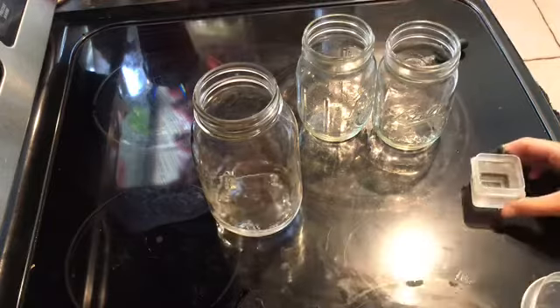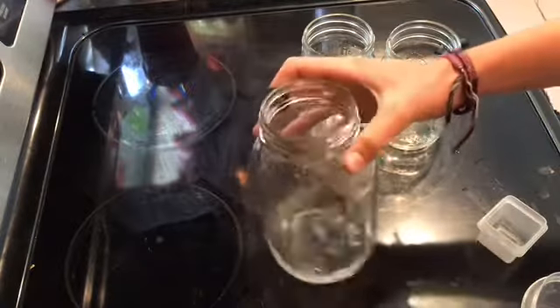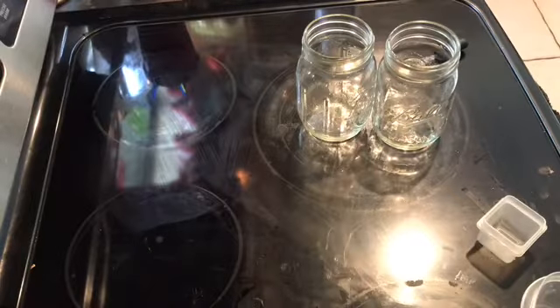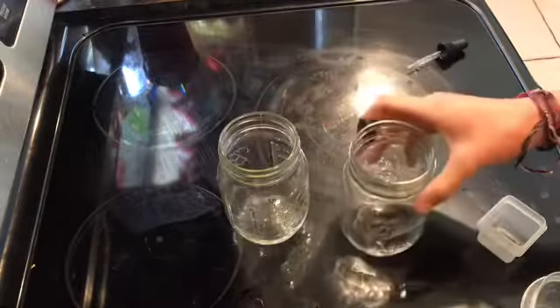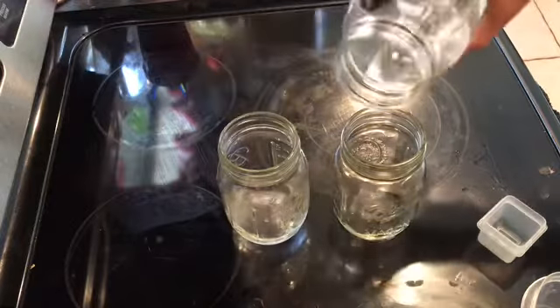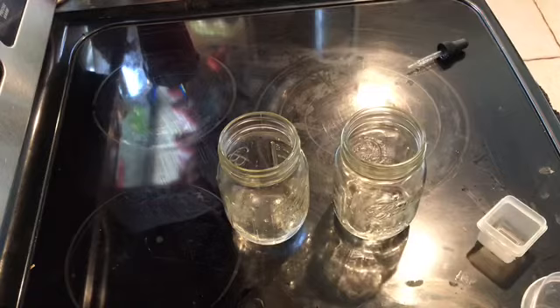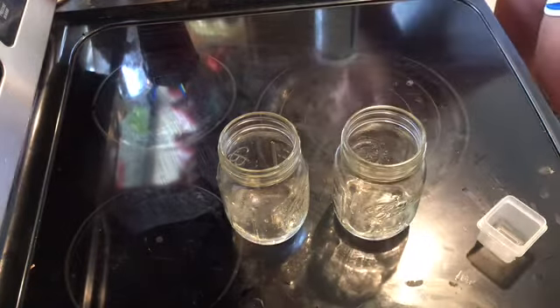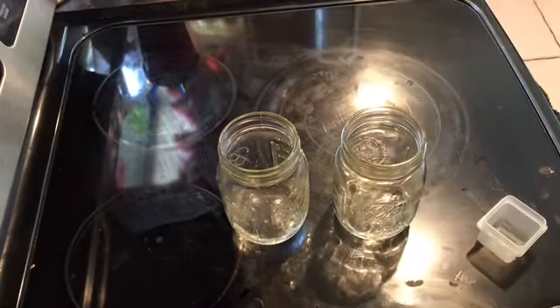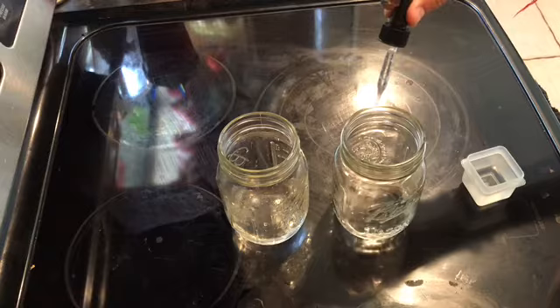Part B, we had a 100 milliliter beaker and two 50 milliliter beakers. We added 20 milliliters of 1 molar CH3COOH and 20 milliliters of 1 molar CH3COONa to the 100 milliliter beaker, and we stirred it. And then we divided that among the two 50 milliliter beakers. That way we had the same pH.